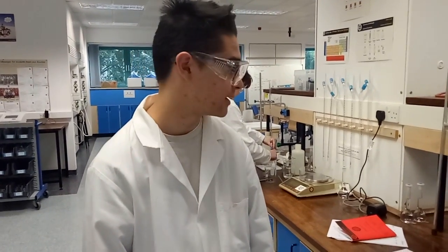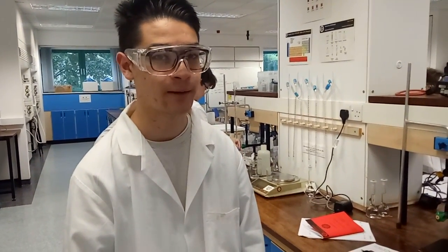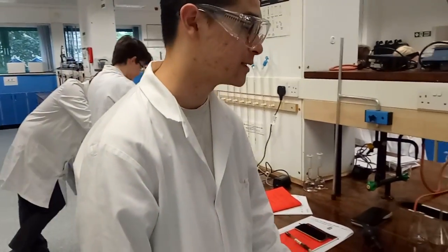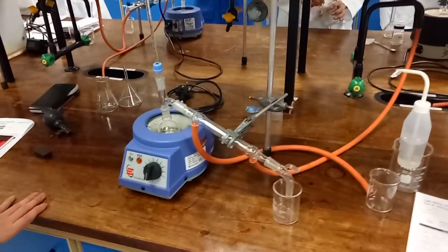My name is Leo Thomson. This is the 4th of October 2016. The lab session is Tuesday morning and I'm in Group 5. I'm explaining the process of distillation.